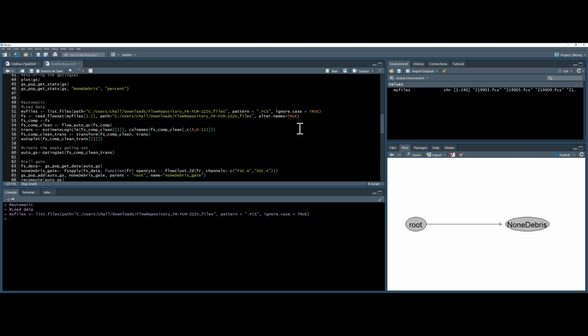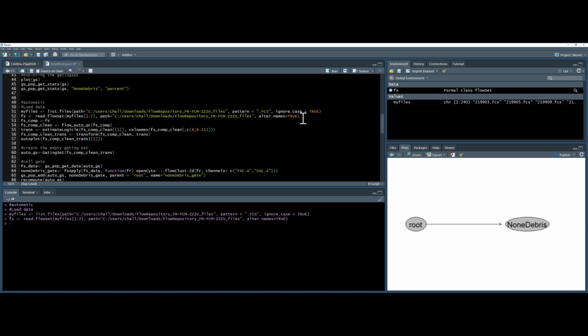You should note that there's a new command here called alter.names equals TRUE. I did a test run of this and had quite a few issues, and I was trying to work out what the issues were. This didn't cause the issue, but it is something you should bear in mind: R doesn't like spaces. It particularly doesn't like forward and back slashes. So when you're loading your data, using this alter.names equals TRUE command will replace all the non-standard characters with dots and X's. This might make the parameters look a little bit strange, but it will behave better in R. So I'll be using that this time. Also, if you're using a Attune like I do, the Attune allows you to use forward and back slashes in the names, and that can cause some real issues. What you can also do is use the empty value command, which you can look up in the help file, and that will allow you to load your Attune data.